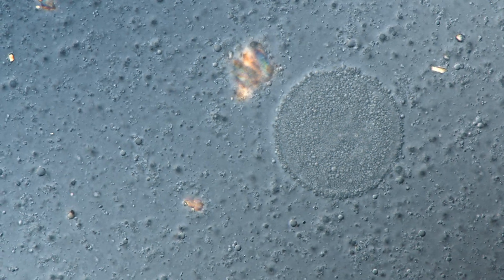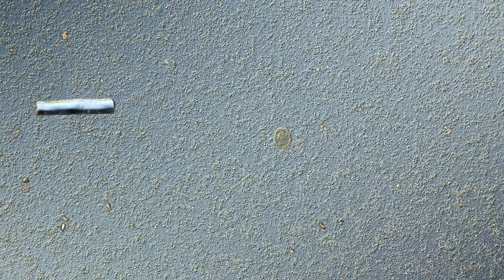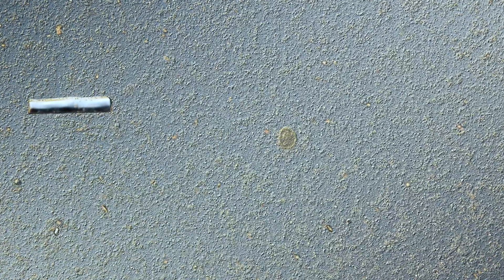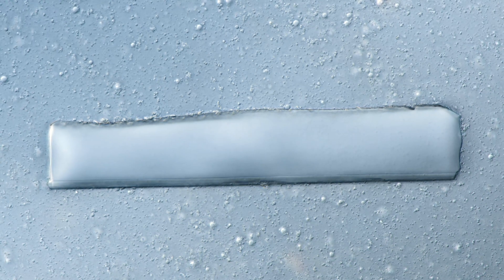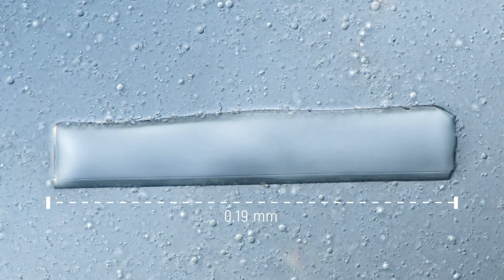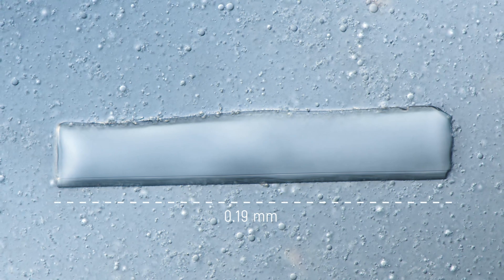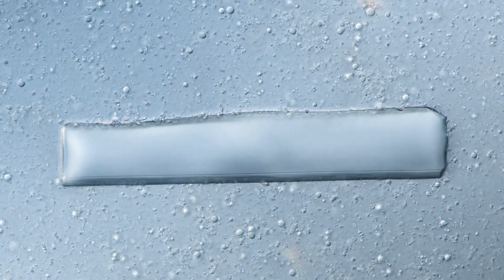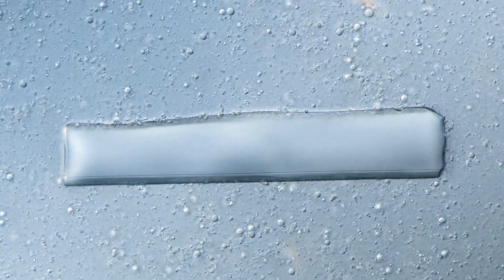On Oatly's ingredient list we can also find items like potassium phosphate, calcium carbonate, and potassium iodide. I'm wondering if you can spot them in this video. They are probably dissolved in the liquid, but maybe some are still in the form of solid crystals.